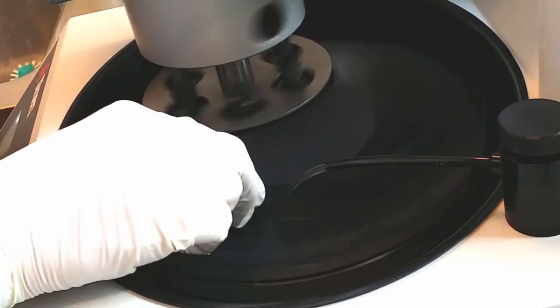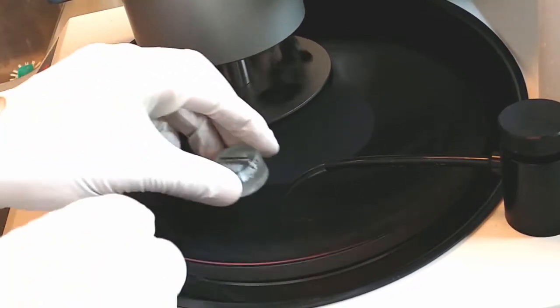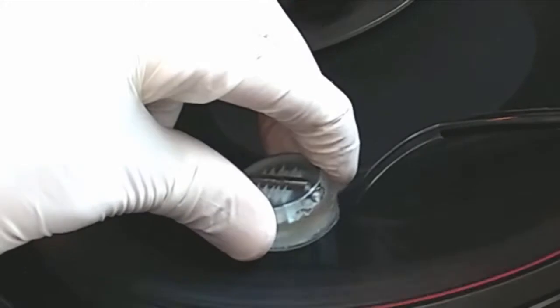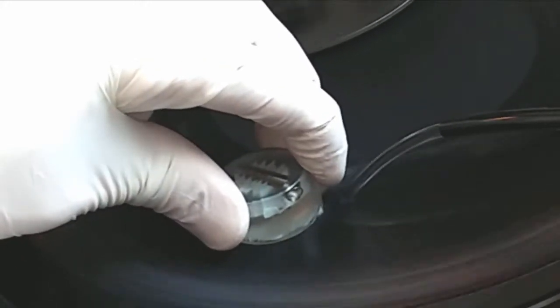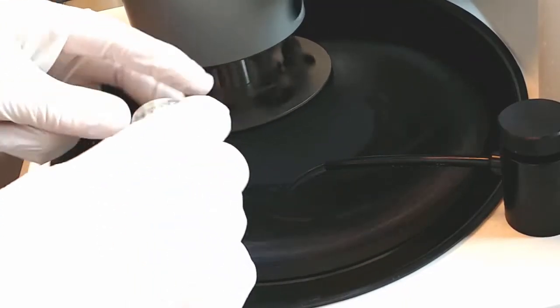Then we turn over the sample and grind it from the front side. We use a coarse paper in the beginning so we can come down to the right dimension and the important sections that we want to study.